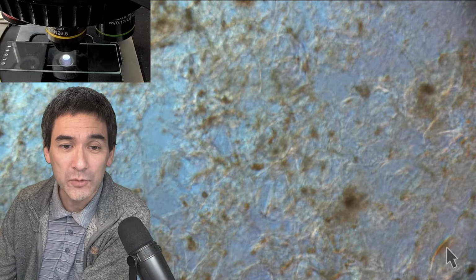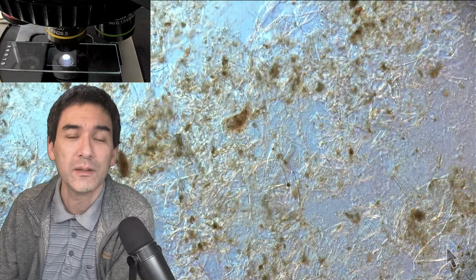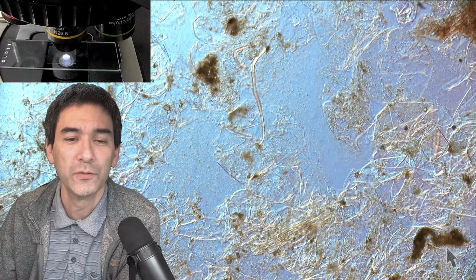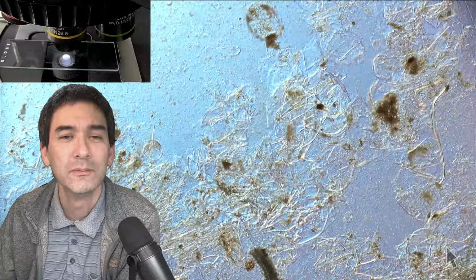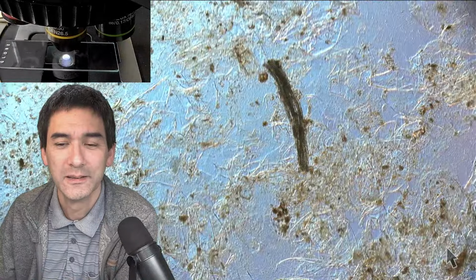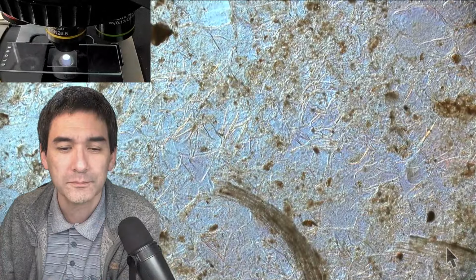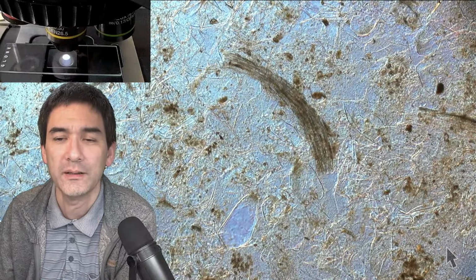And what I'm doing right now is I'm just putting everything there is under the microscope, and I can already see something here. Yes, it looks like a mess. Occasionally with these highly processed foods, I'm really happy if I'm able to find some microplastics. For example, in artificial meat, I've seen quite a few microplastic fibers. So I'm hoping to find, of course, xylem, because that's very easy to identify.